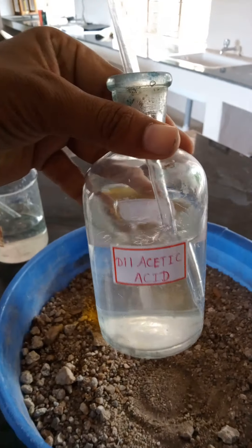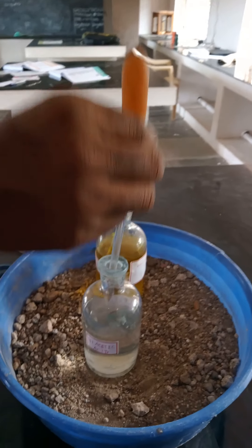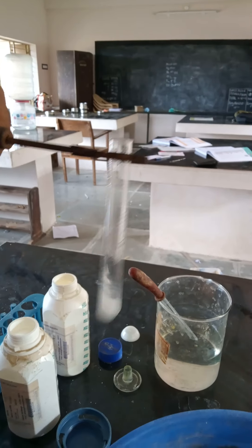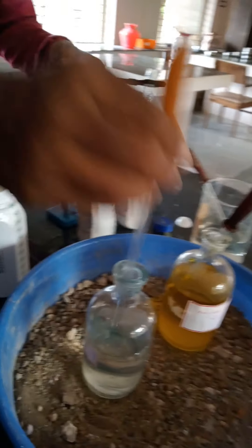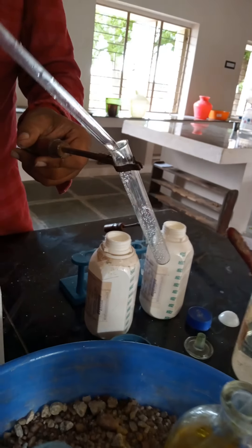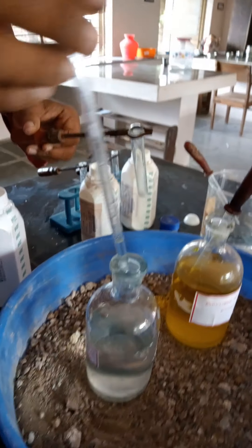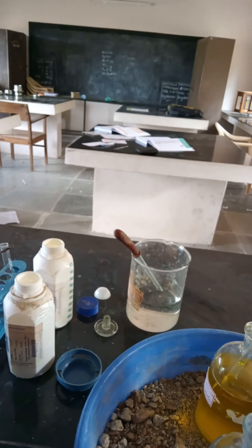Now add dilute acetic acid in all four test tubes. In the first test tube, add the dilute acetic acid inside the test tube. In the second test tube, add the dilute acetic acid inside the test tube. In the third test tube, add the dilute acetic acid inside the test tube.